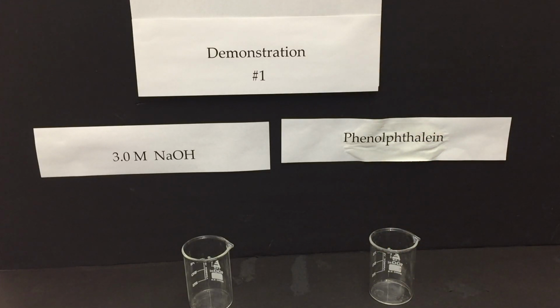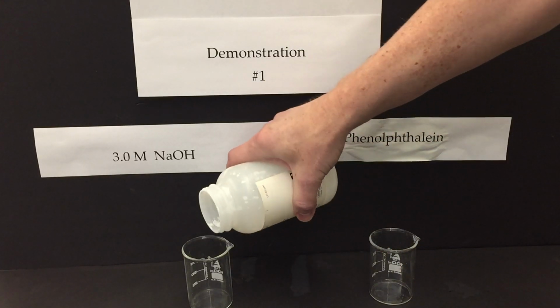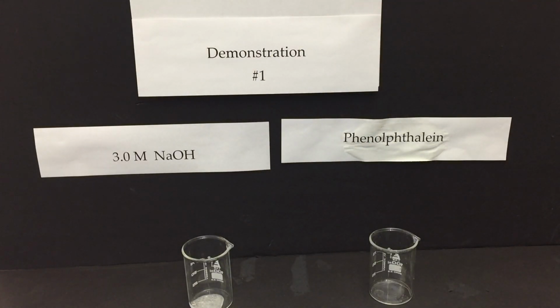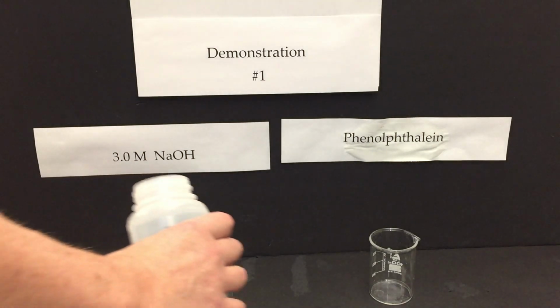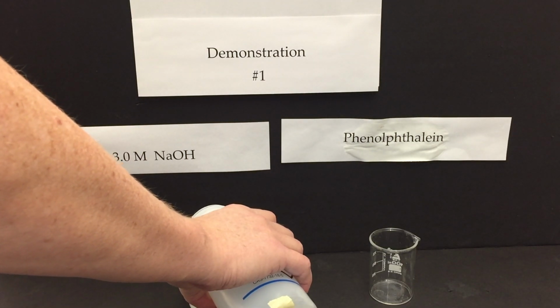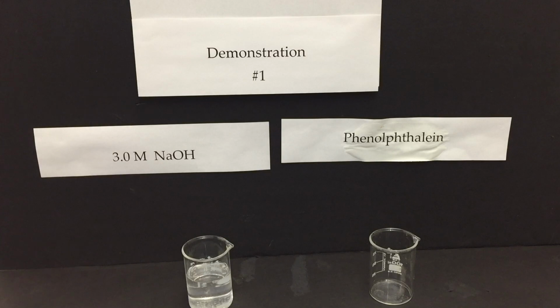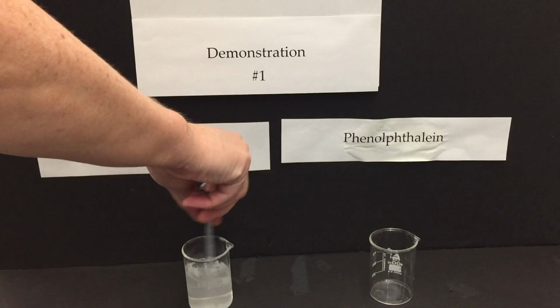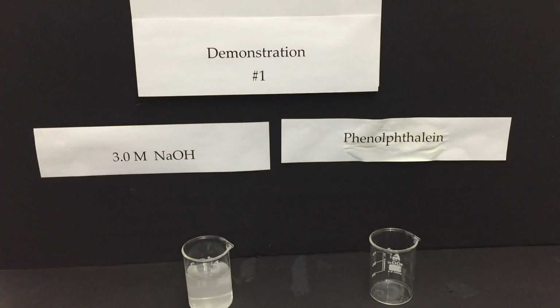If you put in too much, the students will be able to see some of the residue. You don't want them to see that. Make up a solution of some hydroxide, could be sodium, lithium or potassium hydroxide. The concentration doesn't matter. All you need it to be is basic. Basic enough to turn phenolphthalein pink.